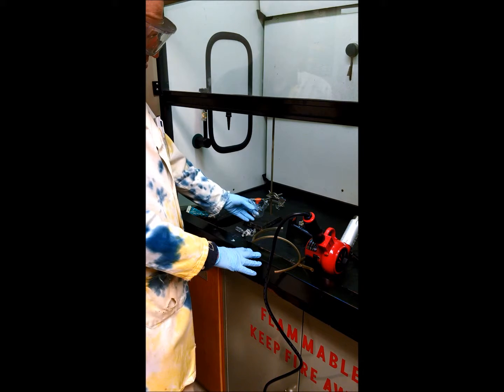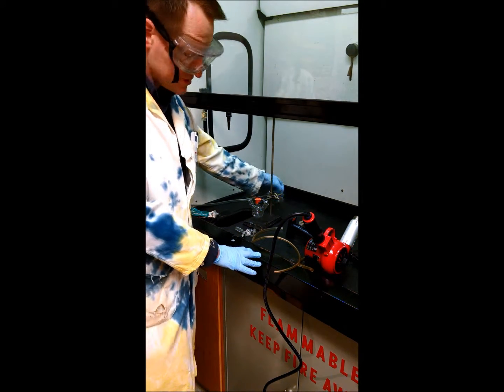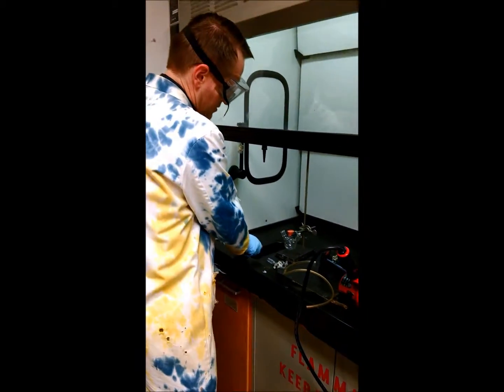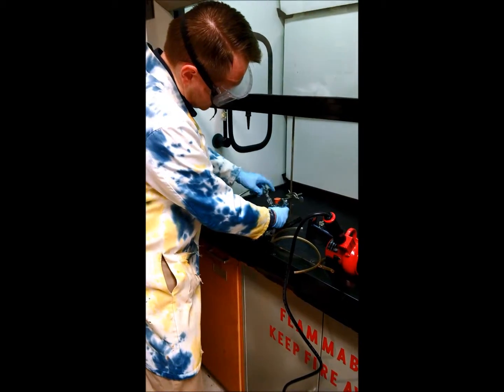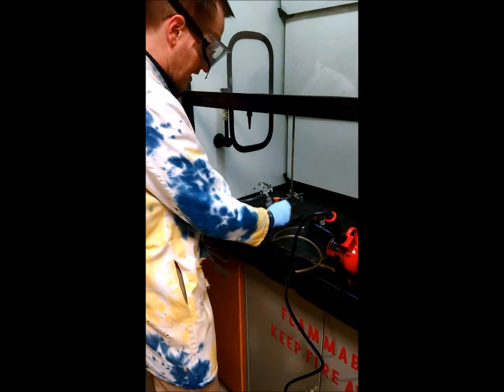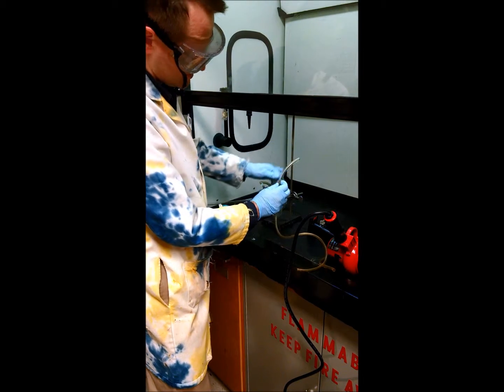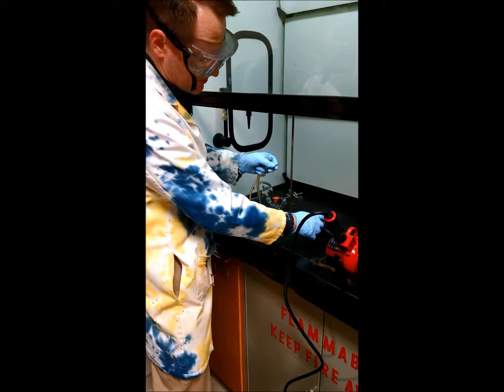We need to generate our hydrochloric acid in this three-neck round-bottom flask and purge it with nitrogen. So we'll connect a tube from the nitrogen cylinder to the flask, using some grease for the ground glass joints, and do the same for the gas to exit. We'll connect that up to a tube, changing the diameter to a smaller tube to go into the IR cell.